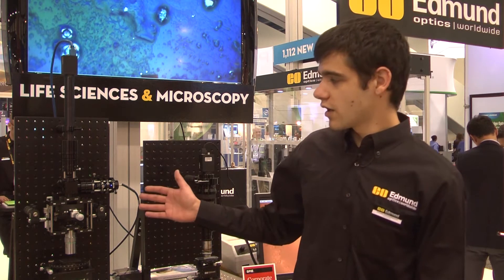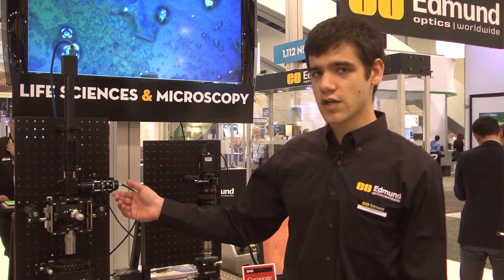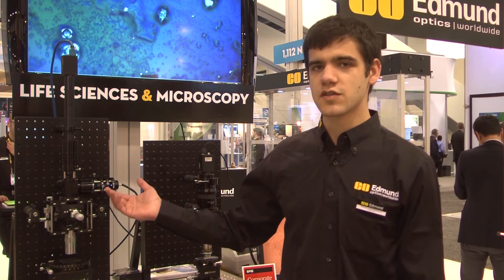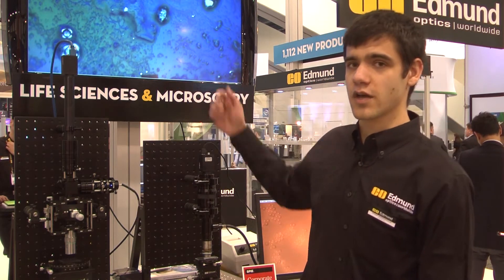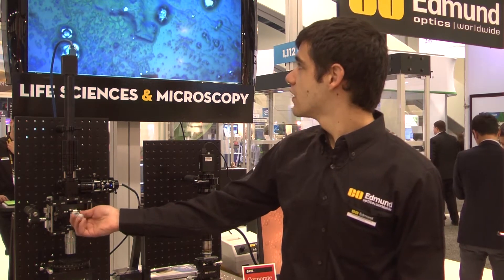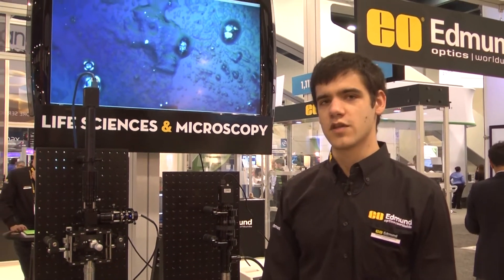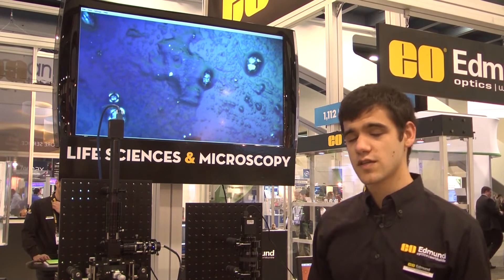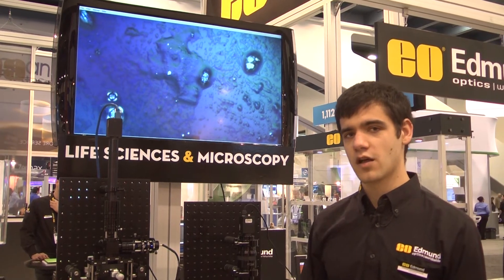Using our stock products we built the microscope, and it can also be used to adjust your contrast. We can move the prism inside, which is essential to changing the contrast which you can see on the image up here. By moving the prism we can change the features you see in the image, and it can be used to analyze your samples such as optical thin films but also biological samples.